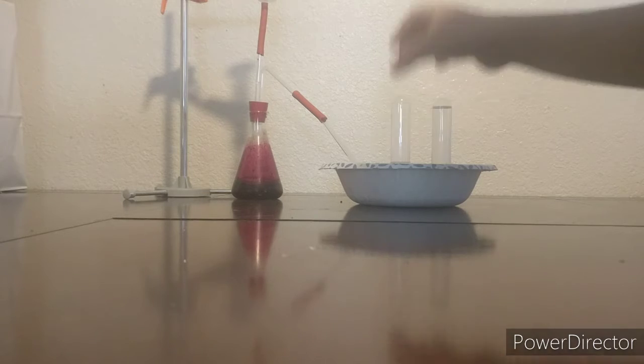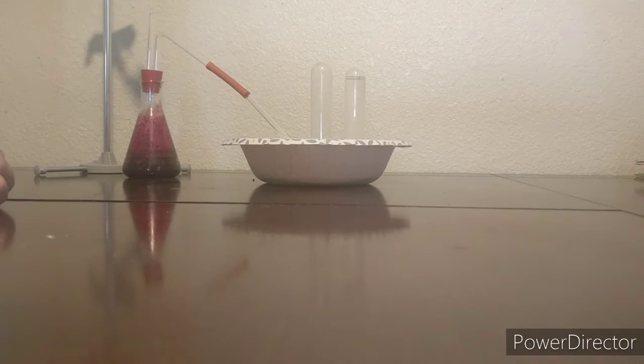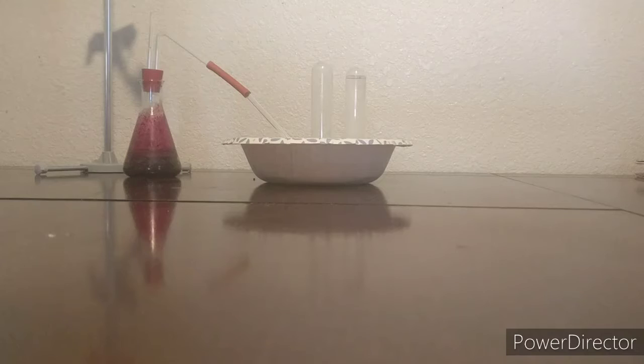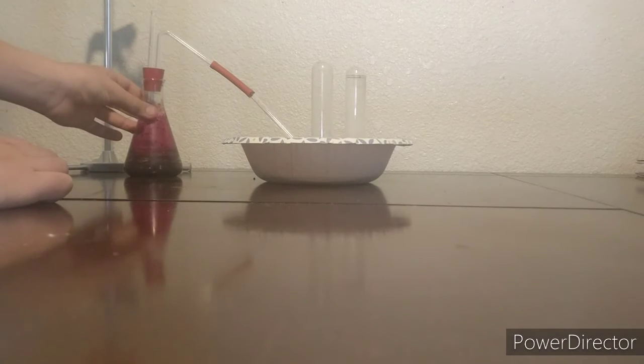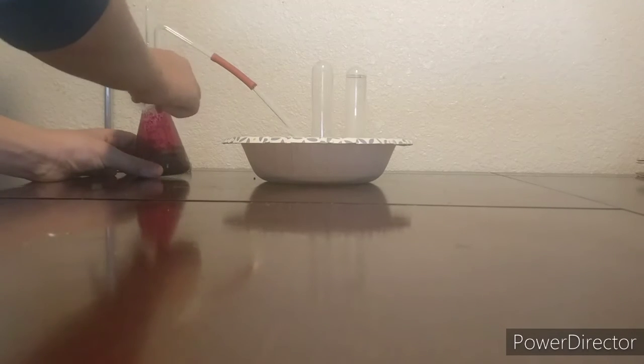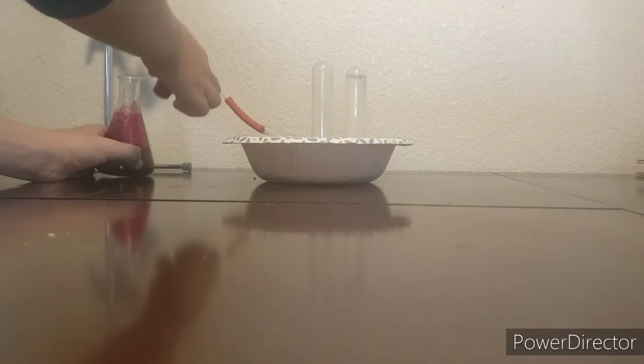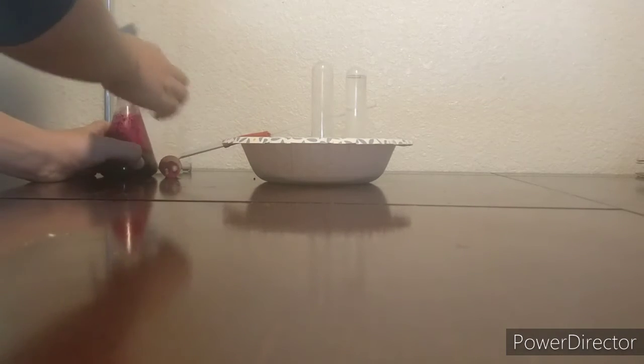I also tried to dismantle the setup and shake the Erlenmeyer flask to make it react a lot more, but in the end, that didn't really change anything. So, I dismantled the whole setup, and I'm showing you guys this test tube with the oxygen.